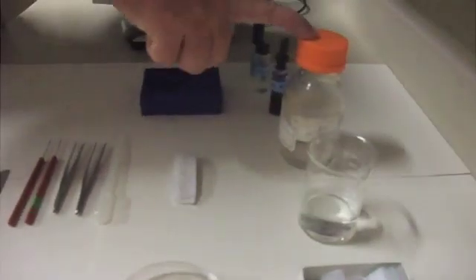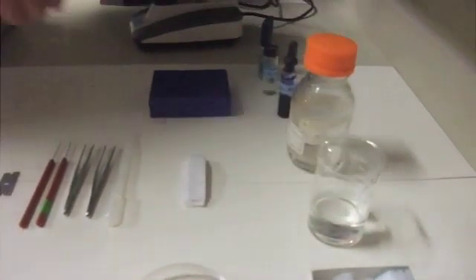What else we need? Then we need some paper towels. Oh, that's easy, yes, for absorption. Good. Petri dishes, just for holding the samples. And then let's start at the beginning, yes. Cover slips, slides, okay. Water, hydrochloric acid. What is that for?